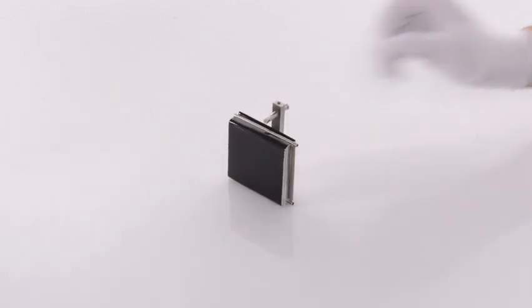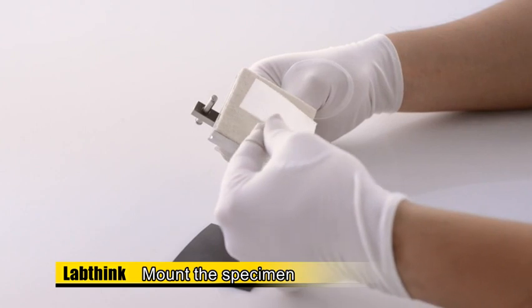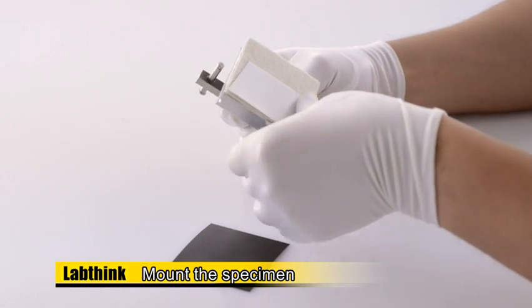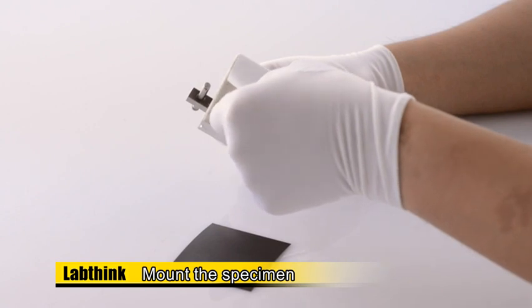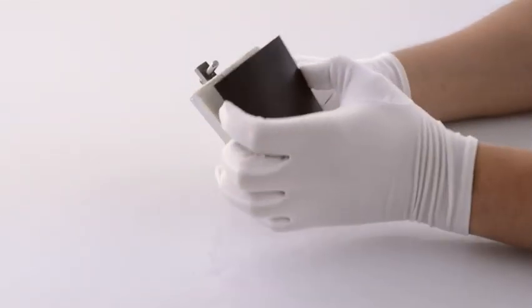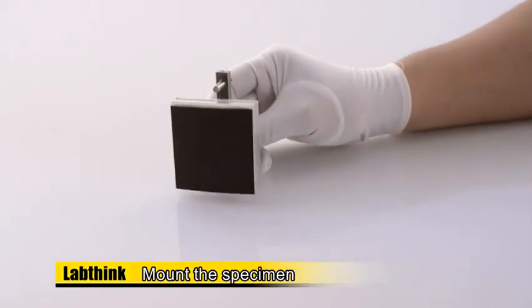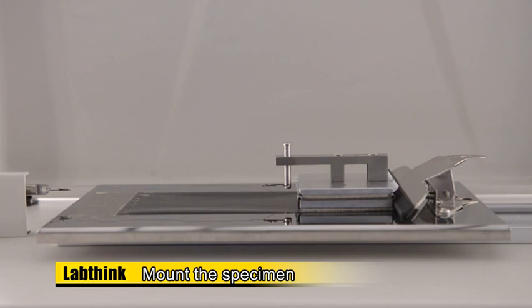If the specimen is a rigid material, fix the 63.5 mm by 63.5 mm specimen on the back of the sled directly with double-faced adhesive tape. Then place the sled with the loaded specimen at the center of the plane.